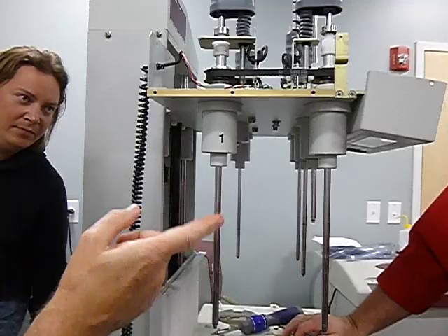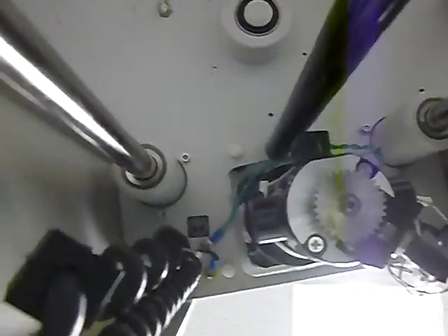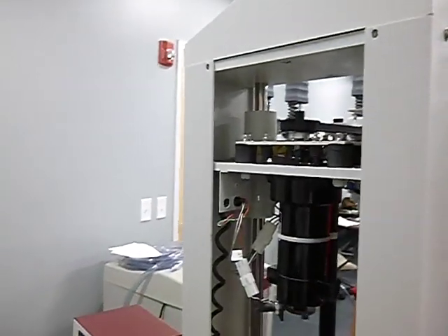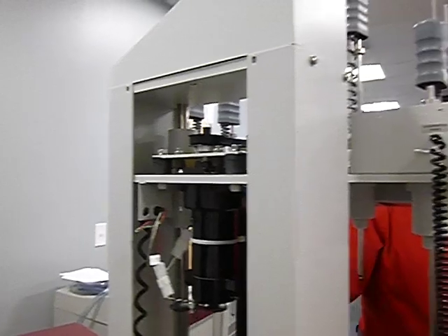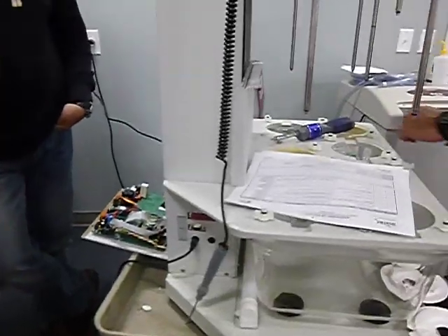Are we going to talk about electronic problems later on? Some of the electronic problems. Yeah. I know that power supply might be causing inconsistent temperature readings. So on this model, I know that... Yes. We've had to change the power supply. We've had to change the board itself. We've had some various issues with different things that go on electronically with it. There's a lot of things.